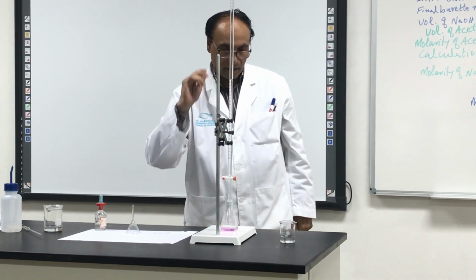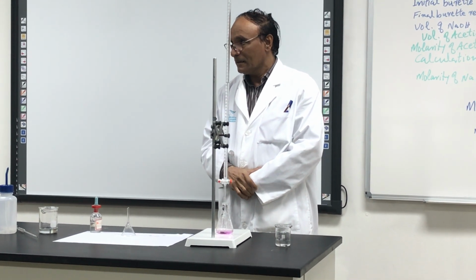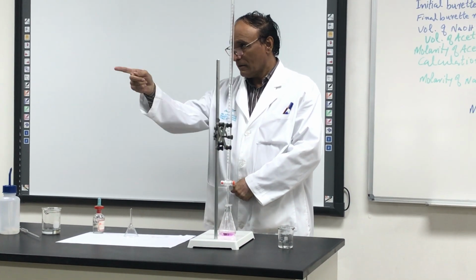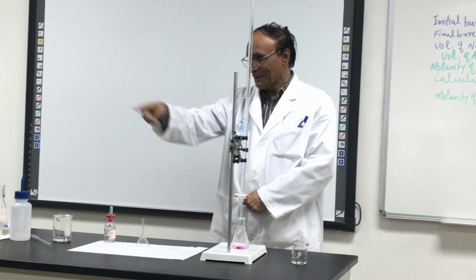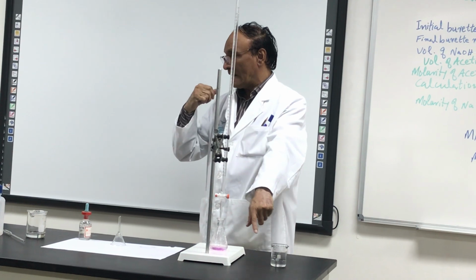And I stopped. Right? Oh my god. Is it the end point? No. Is it the end point? Yes. Shake it.